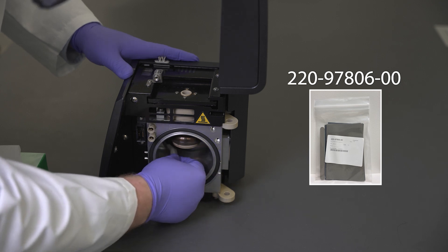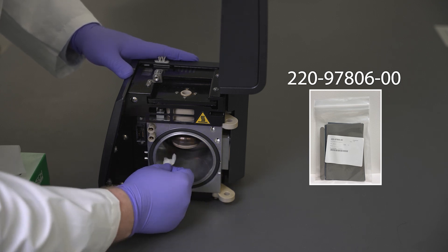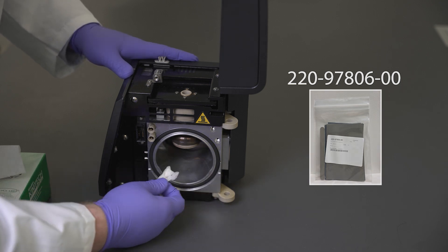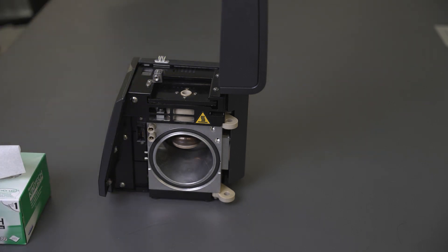Gauze or an abrasive kit is available to help with the cleaning process. Water is recommended for salts and methanol for organics.